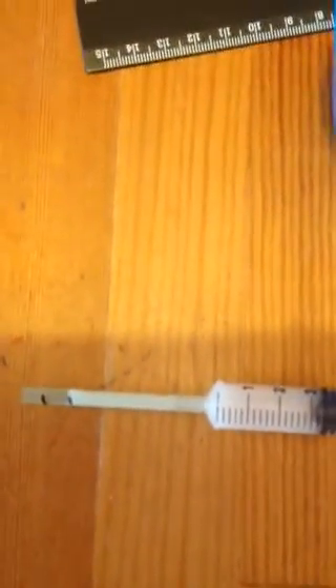You'll have to try out exactly how much sugar to use. Just insert the fluid, start your stopwatch, and watch it move up to the mark and time how long that takes — and that's basically the experiment, and it works, which is nice. The top tip is that students should really hold the straw firmly onto the syringe to prevent any air gaps getting in and stopping the reaction from working. The important thing is to double check the temperature of your yeast suspension when you're using it. I hope that was helpful — have a go yourself.